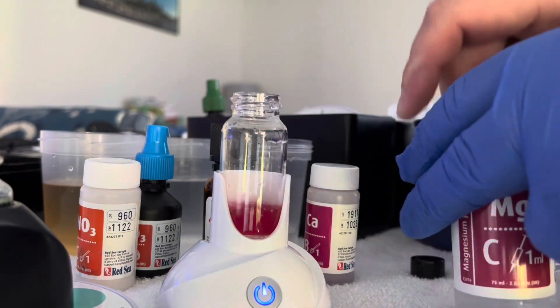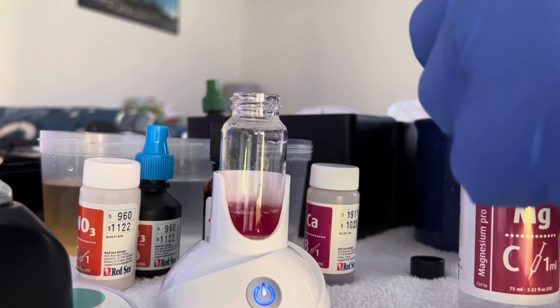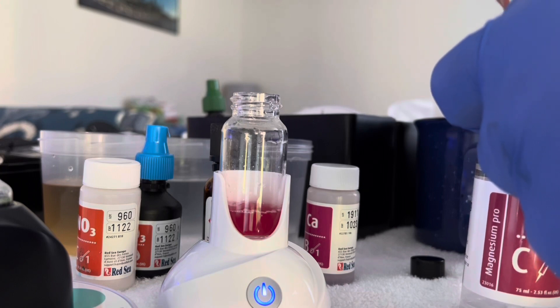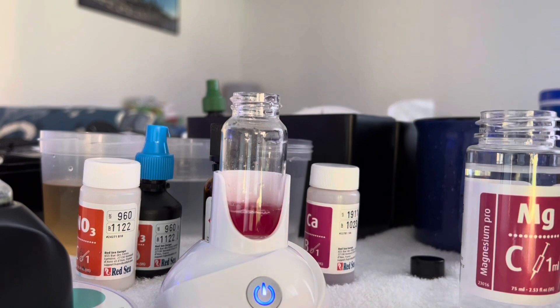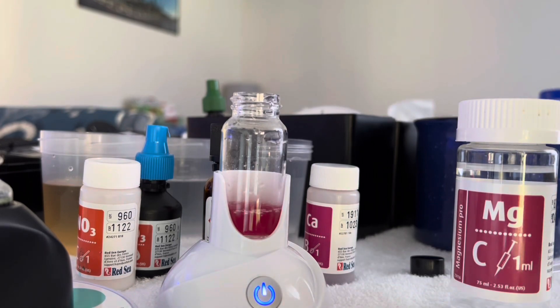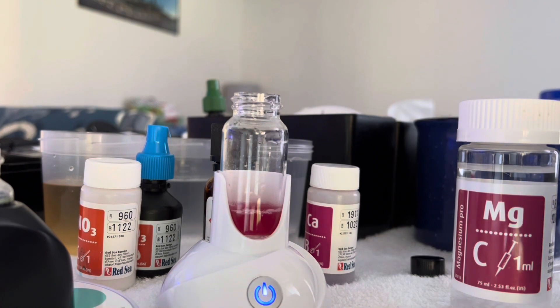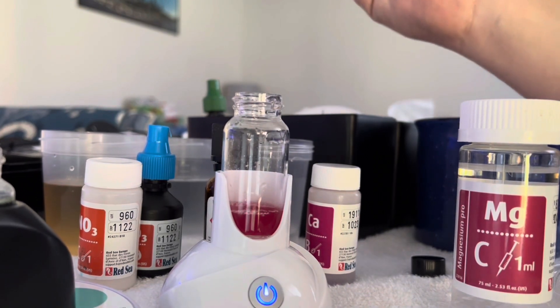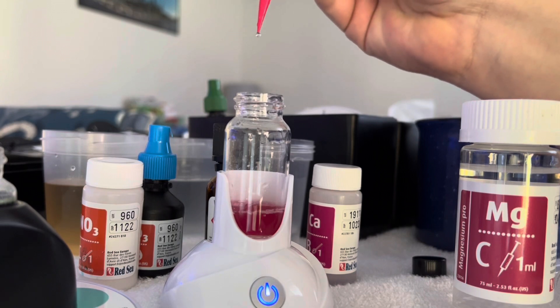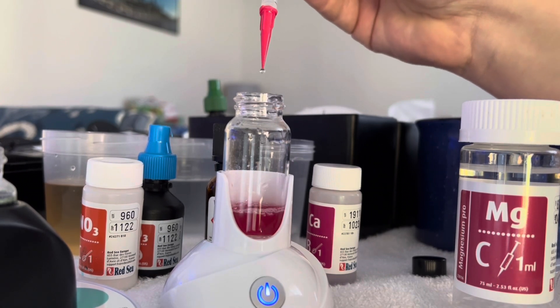While that's stirring, I like to get my titrant ready — first drop. Magnesium acts as kind of a buffer and stabilizer between calcium and your alkalinity. I think we're having precipitation issues and I'm just not seeing it anywhere, so maybe our magnesium is low. Alright, it's time to start the titration.